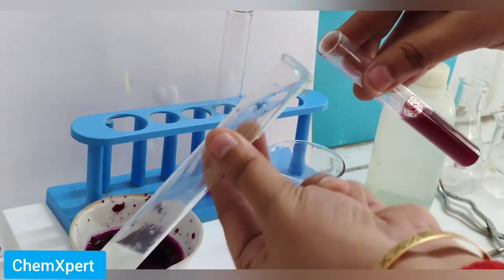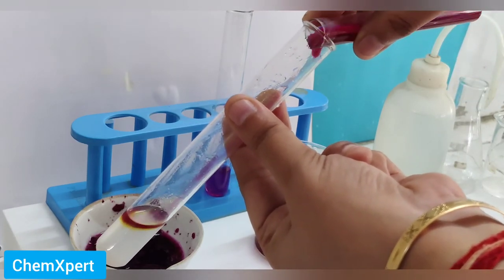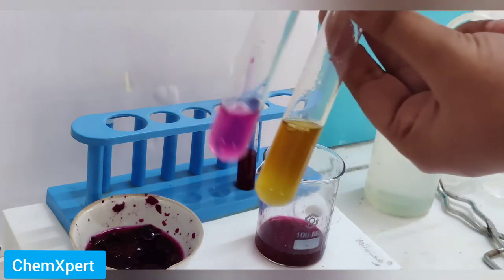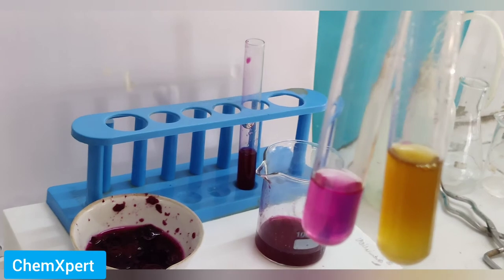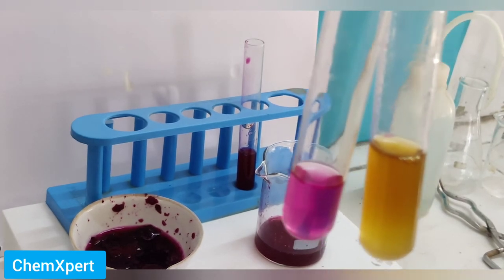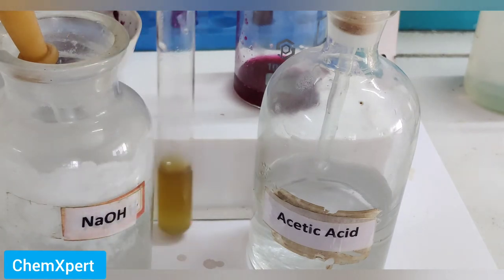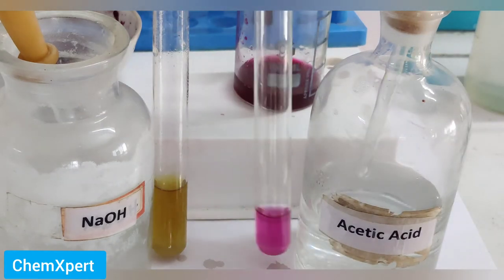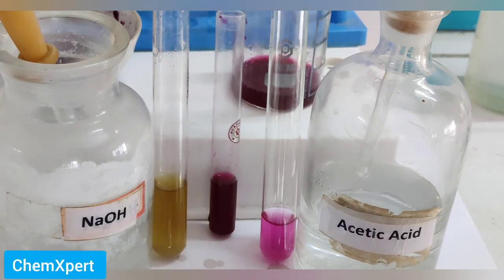Now in another test tube I have taken NaOH, and I will add this beetroot solution. The color of the solution changes to a slightly yellow color. So the dark magenta color of beetroot changes to yellow in a basic solution and to slightly pink in an acidic solution. Final observation: basic solution gives yellow color, and acetic acid gives slightly pink color.